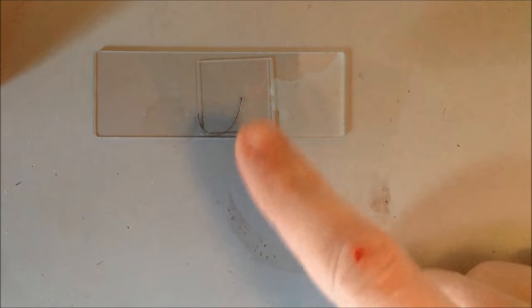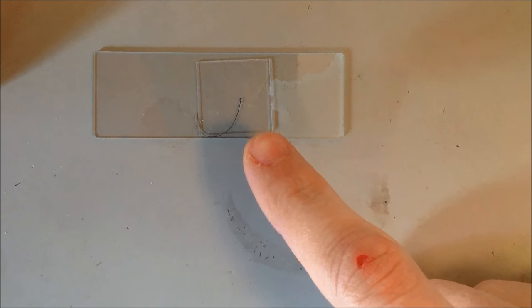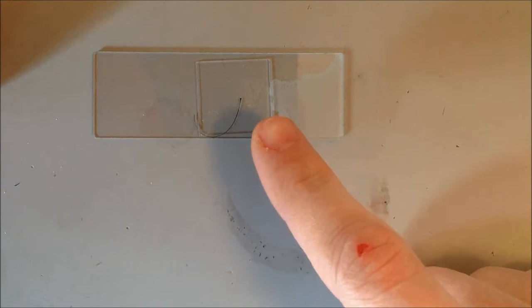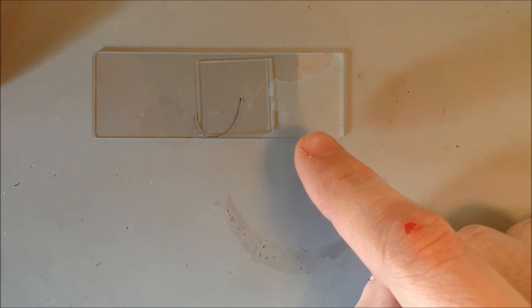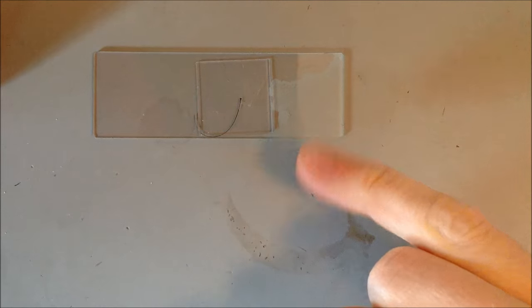So this is the view of our slide, our prepared slide, with the cover slip on top, the string in between, the water in between, the cover slip and the slide. And so this is what we'll go ahead and put on the microscope.